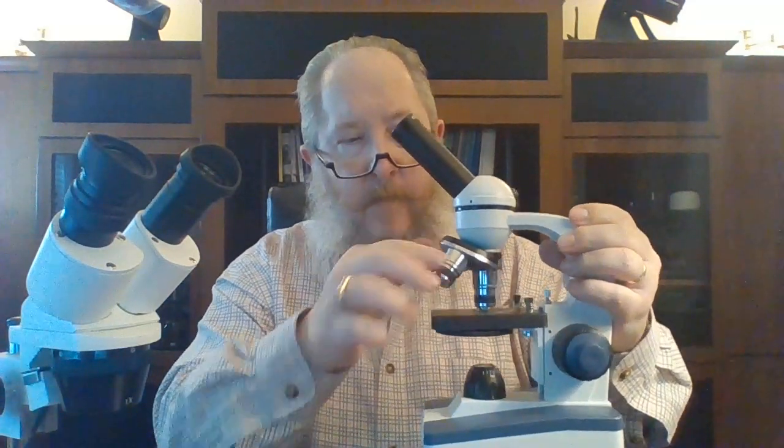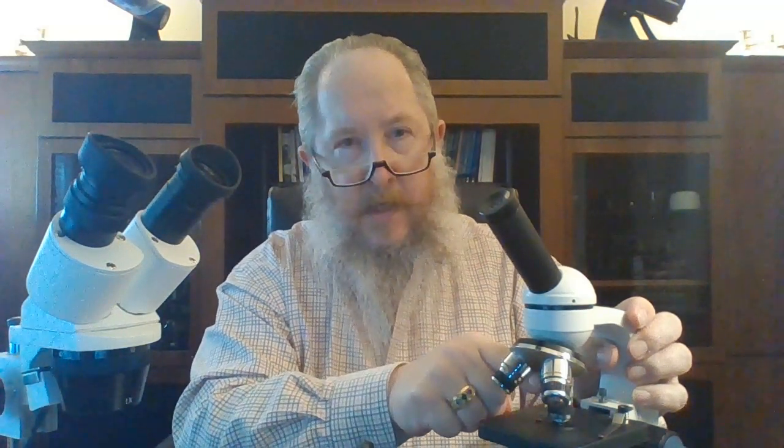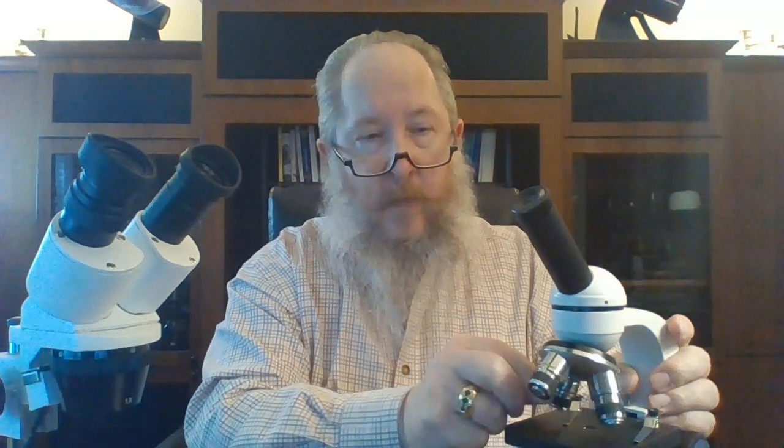Compound microscopes, also often called biological microscopes, tend to have the more traditional microscope shape with multiple objectives that rotate around. This happens to be our Celestron Labs 1000 series. This happens to be a monocular microscope, so you have one eyepiece looking through one objective lens at any given time. It doesn't give you the stereoscopic view of a stereoscope, but it gives you much, much higher levels of magnification. Rotating through the objective lenses, you'll find one at 4x, one at 10x, and one at 40x. Combining those with this 25x eyepiece, you multiply the eyepiece by the objective lens and that gives you your magnification.